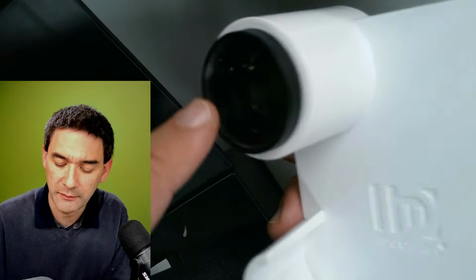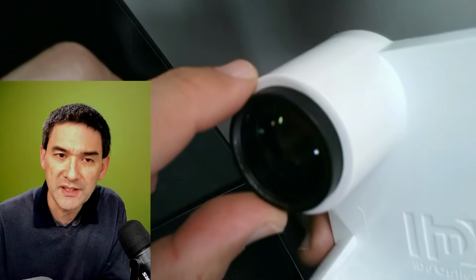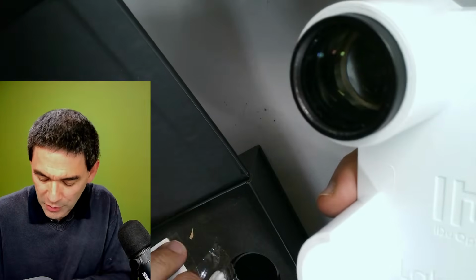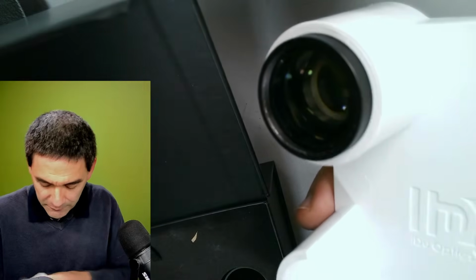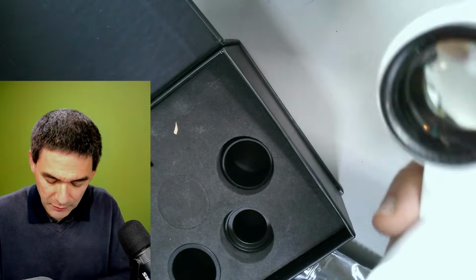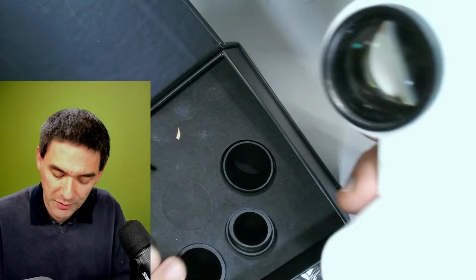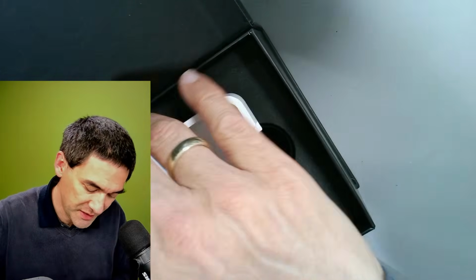The optics itself, it's also interesting why this was included, but I guess the reason is so that you get a full field of view. So this is quite an interesting concept as well. And what you have here, of course, is different diameter adapters for different microscope types. Because, for example, stereo microscopes have a 30 millimeter diameter and so on. So quite an interesting idea here.